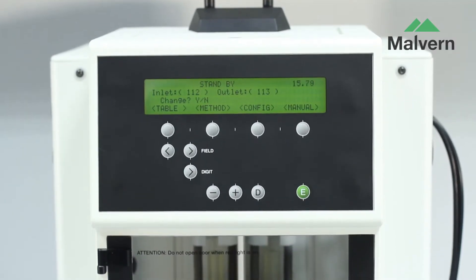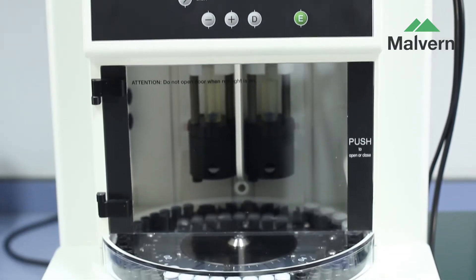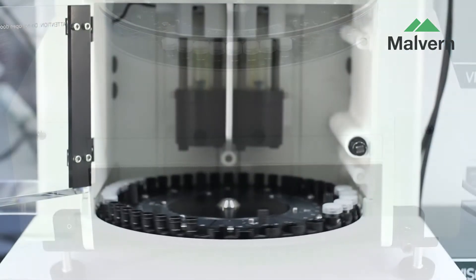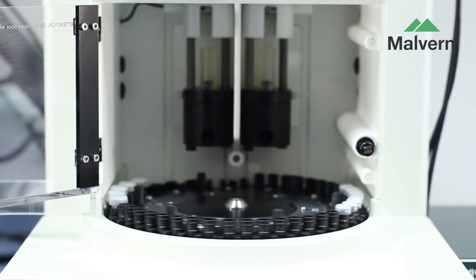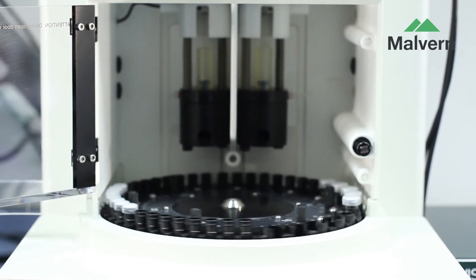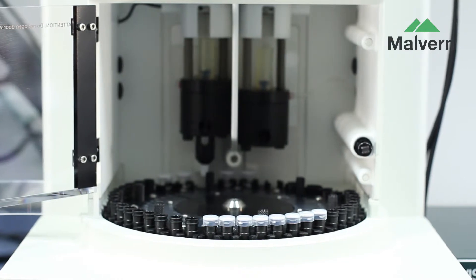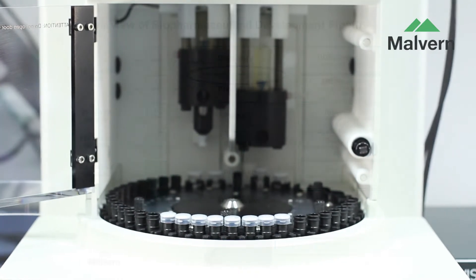If you're interested in measuring the viscosity of your biopharmaceutical formulation very early in development, or sizing particles such as aggregates in complex buffer systems or excipient-laden formulations, the Viscosizer 200 is perfect for your application. The instrument is often used as a screening system, rapidly and automatically analyzing very low volumes of sample available during early phase development, including pre-formulation development.